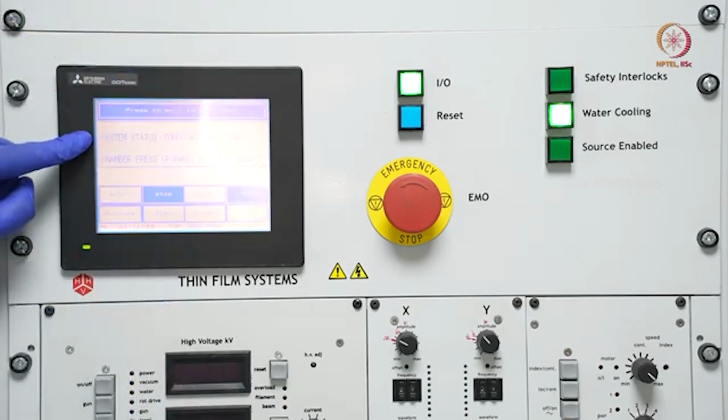See, it is showing turbo acceleration. As the turbo pump was off, it had 0 RPM as rotation. Here it will increase to 13,000 RPM, its rated speed. That will take some time, which is why we are seeing the system status as turbo acceleration. It will become turbo ready. When the turbo pump is ready, we can go for vacuum cycles. So let us wait for some time as long as turbo acceleration is going on.